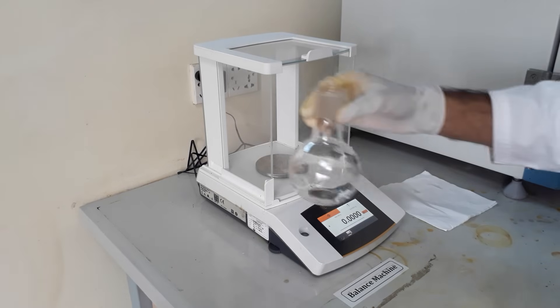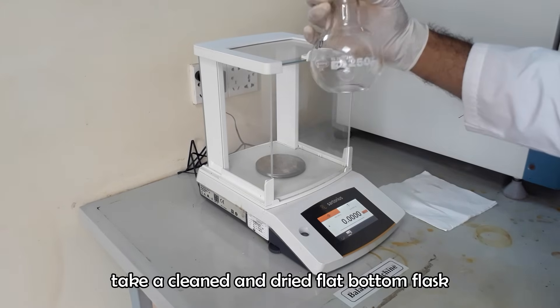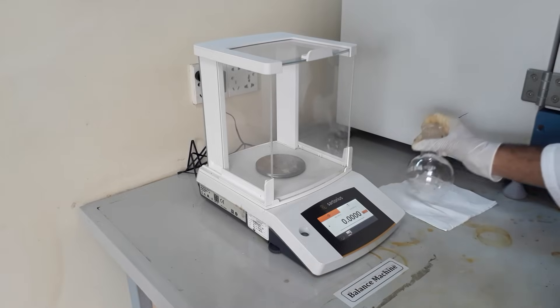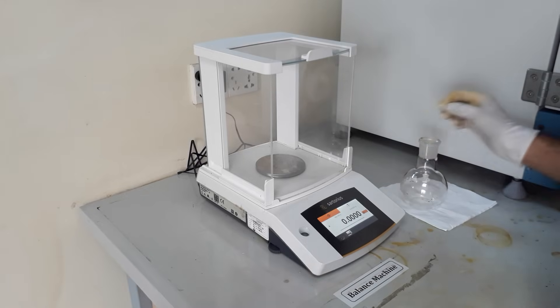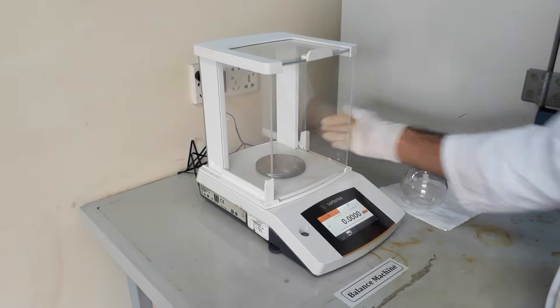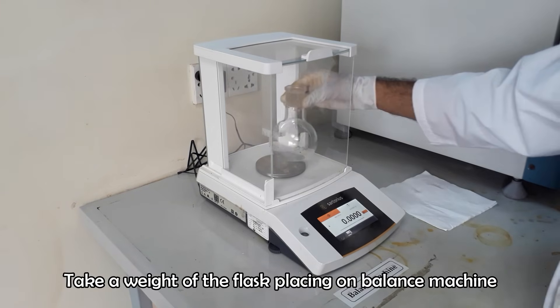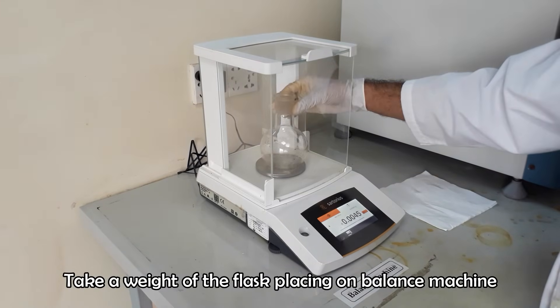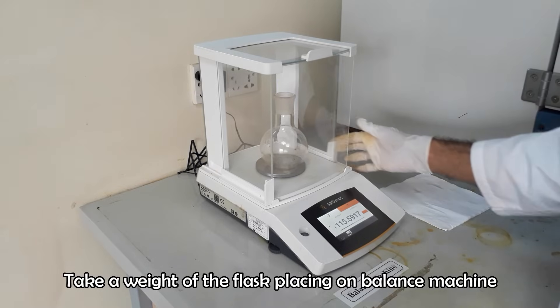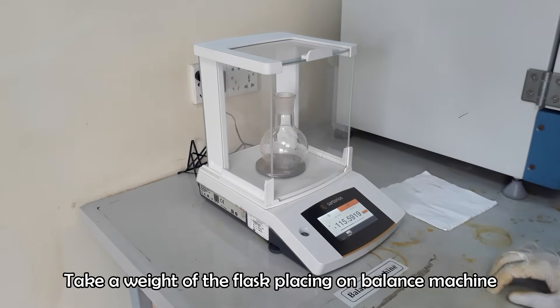Take a cleaned and dried flat-bottom flask of the Soxhlet apparatus. Take the weight of the flask and note it down.